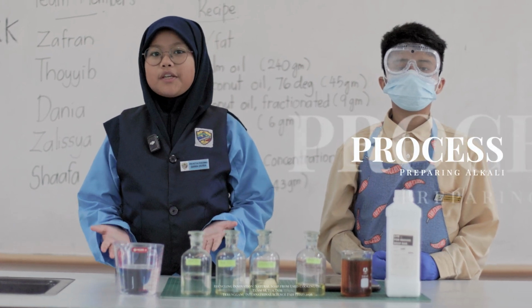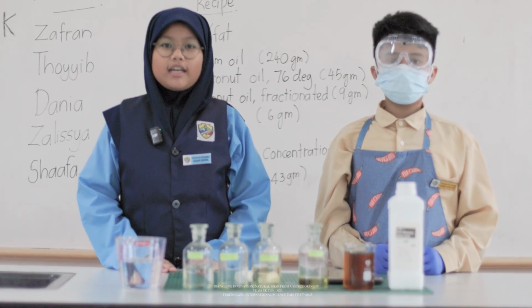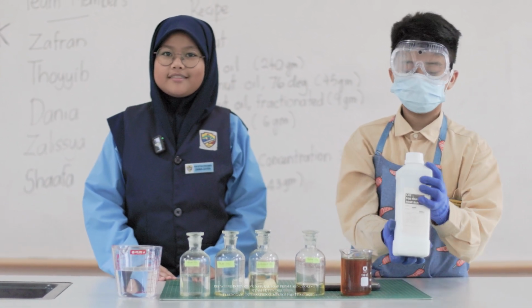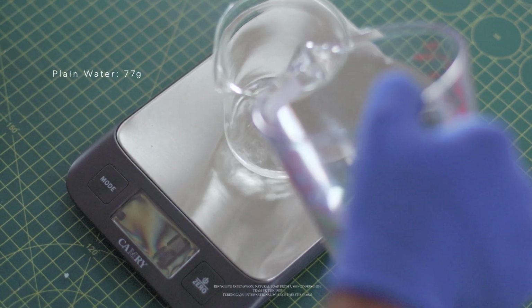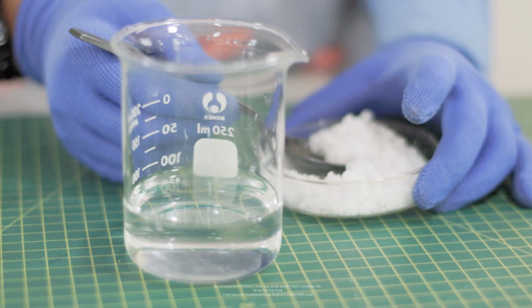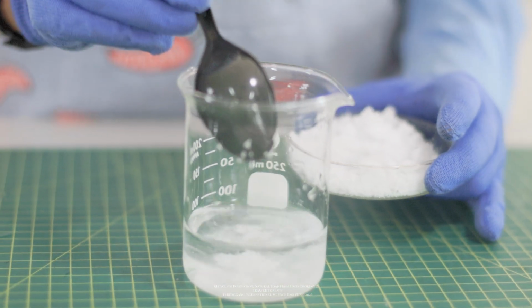For safety, we wear gloves and safety glasses while handling sodium hydroxide. Natrium hydroxide is mixed with water to make an alkali solution.